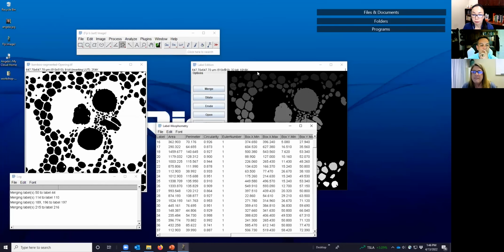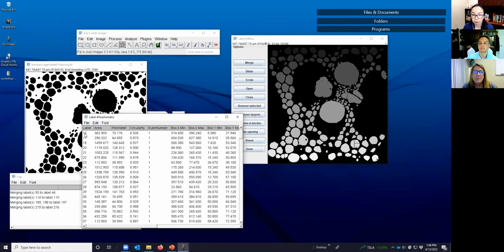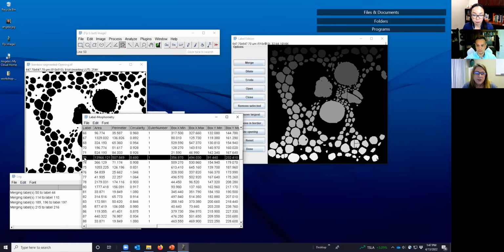So here we have our table, and on the left is our label corresponding to each of the labels that show up in the status bar. So 72 is this large one. If we wanted to look at the area, we could scroll down and say, okay, this is 72, and the area is 13,966 microns squared. All right, so what if we wanted to sort these in some sort of order?